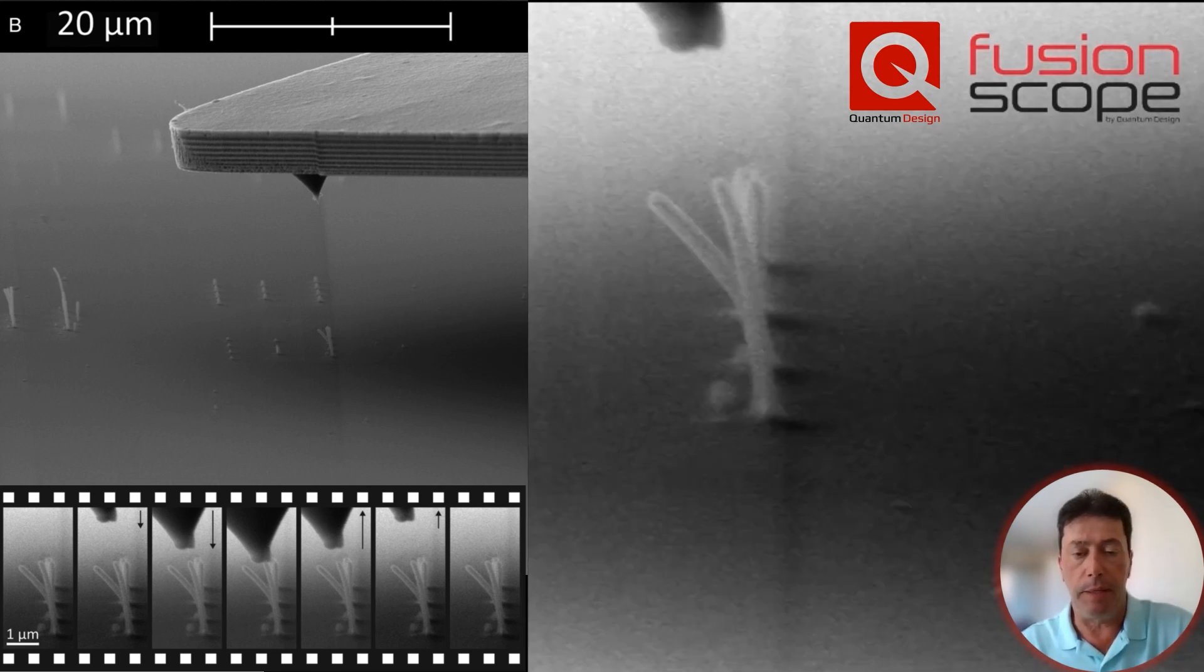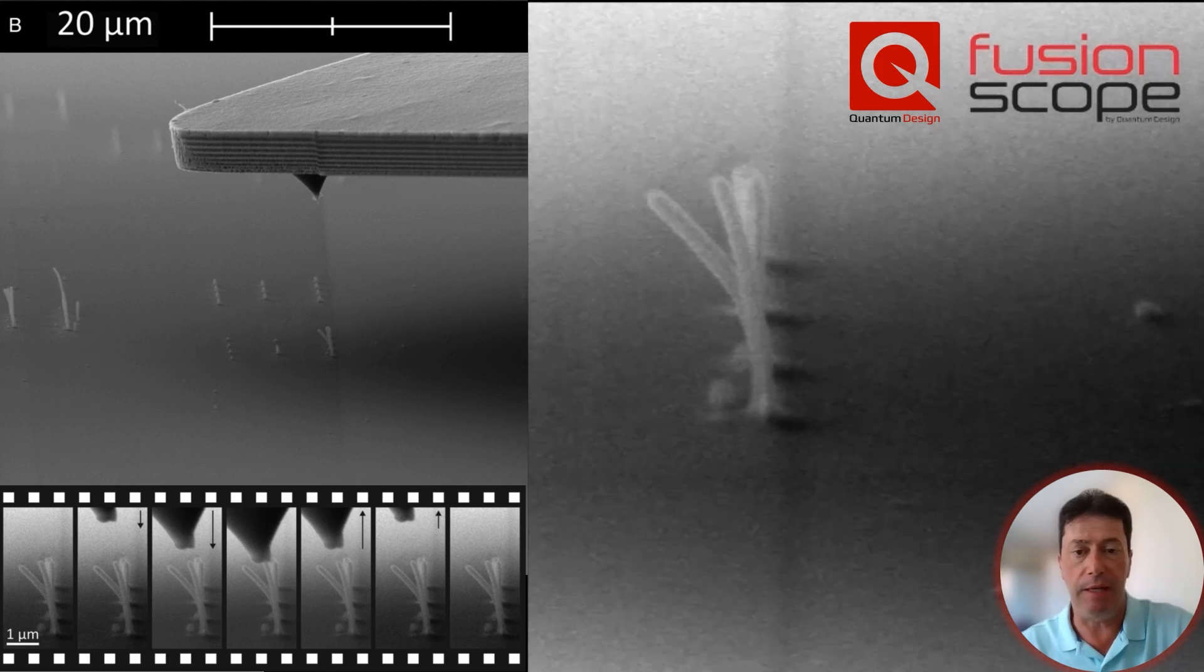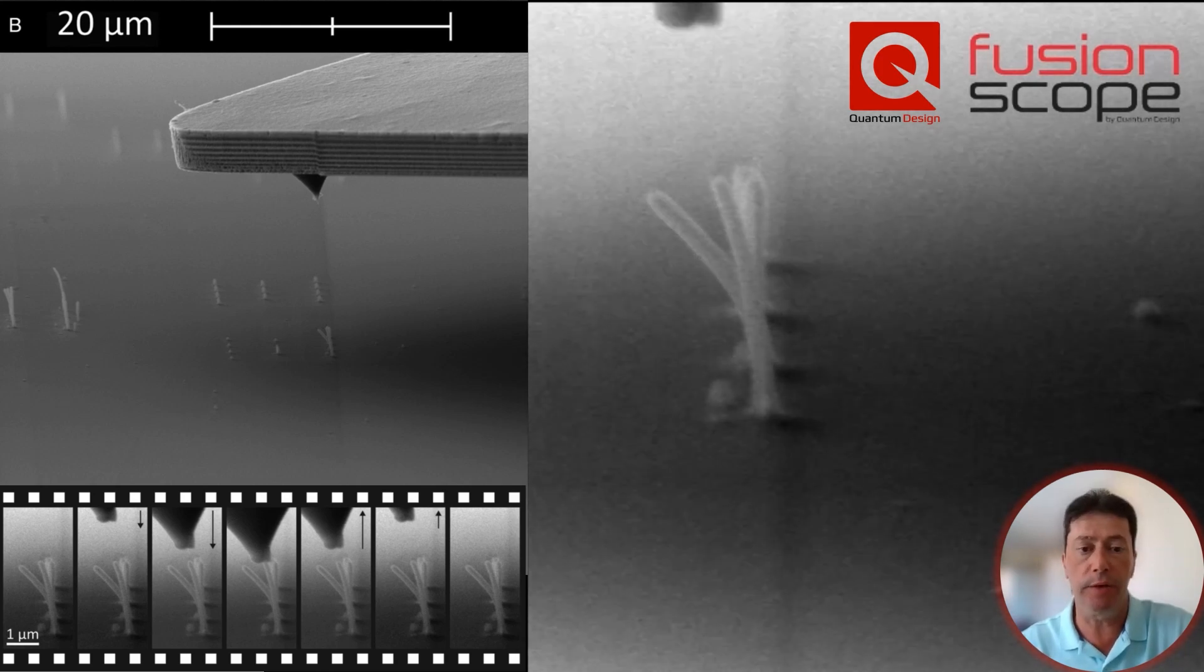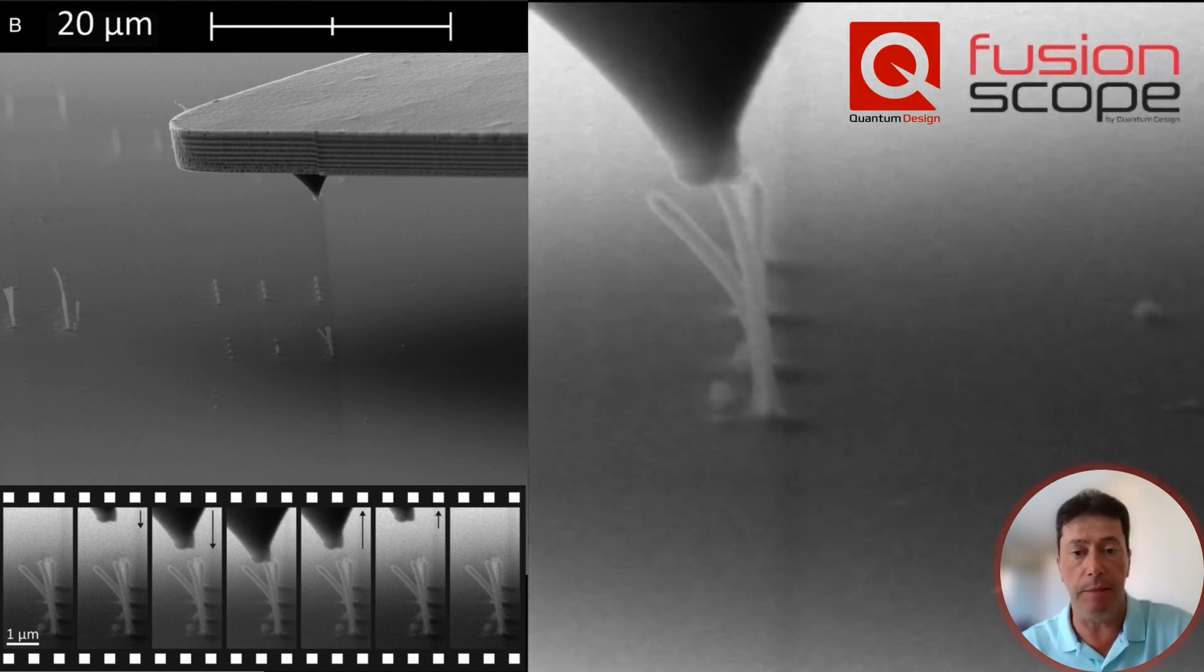Given the small diameter of the pillar, aligning the AFM tip with the pillar requires accuracy achievable only with the aid of SEM imaging.